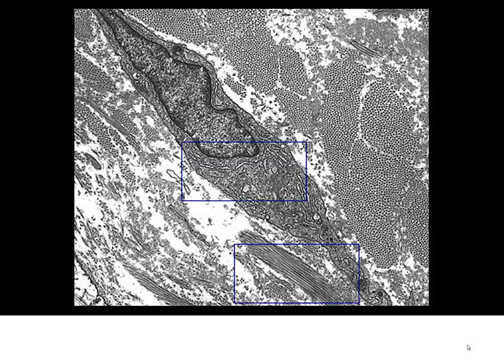And we have already seen this one in our lecture for connective tissue. We have a fibroblast, elongated shape, elongated nucleus. We have our fibrils that we see here in longitudinal section, cutting cross section. Do you remember from lecture what these are? Now again, you may be tempted to think that we're looking at striated muscle. You can see some of the striations here, but you have to remember the scale that we're looking at. This is an entire fibroblastic cell. Our muscle is a lot bigger than that. So we're on a very small scale here.